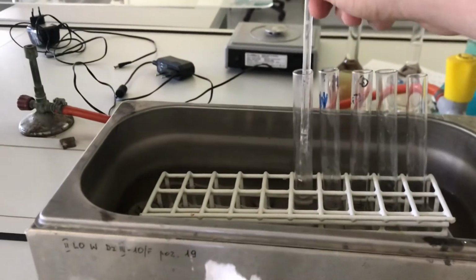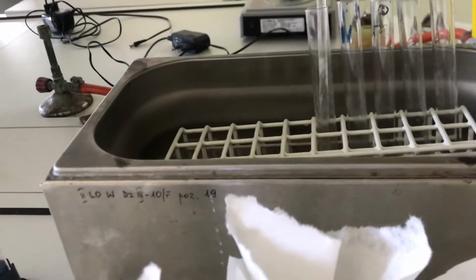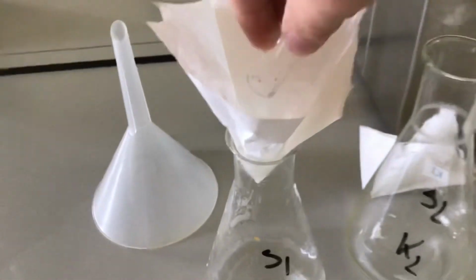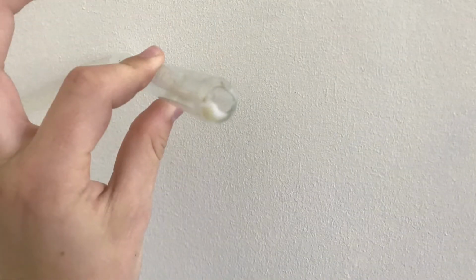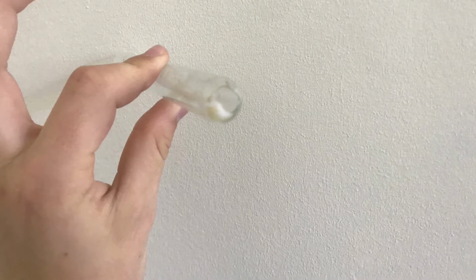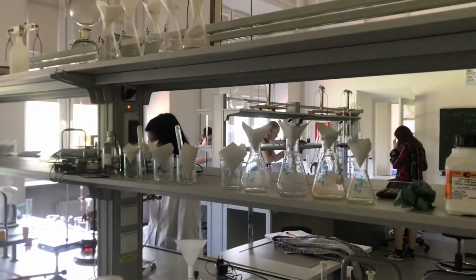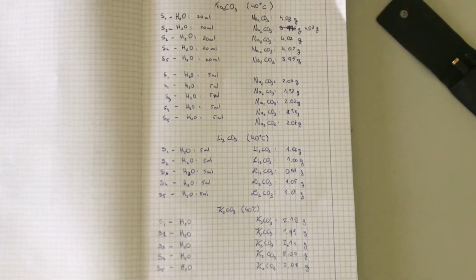Then, after a longer period of time, I mixed the salt for the last time really quickly so that the residue would not stay at the bottom of the tiny utensil, and poured it in through the filter. While mixing, you have to watch out as to not break those containers, as they are made out of very thin glass. I, unfortunately, managed to break one though. I did the same for every flask, and here is all of them. Of course, never forget to note these things down.